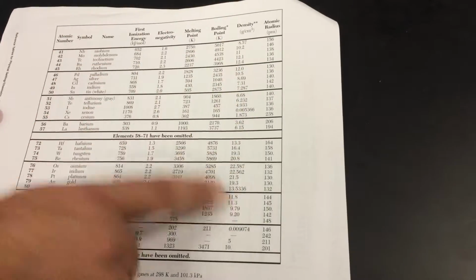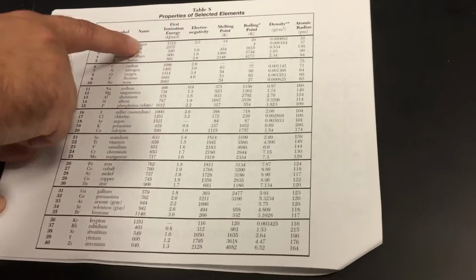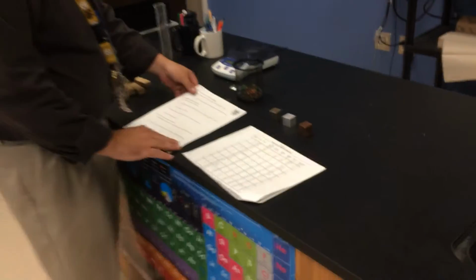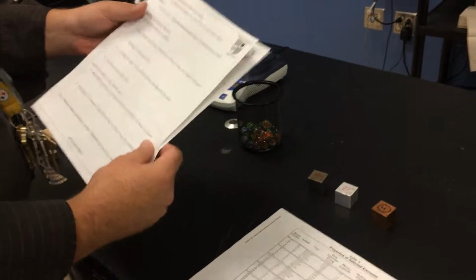Here's the density. Here's the elements. There's 2 pages of this bad boy. This is table S. You're going to get to know it well as you figure out what elements are which, because it does give us our symbols and our names. As we're learning those, that's going to help us quite a bit. Based on your calculation, we're going to figure out who matches up the best, what is your unknown sample. That goes here. Silver, aluminum, lead, magnesium. We're good.